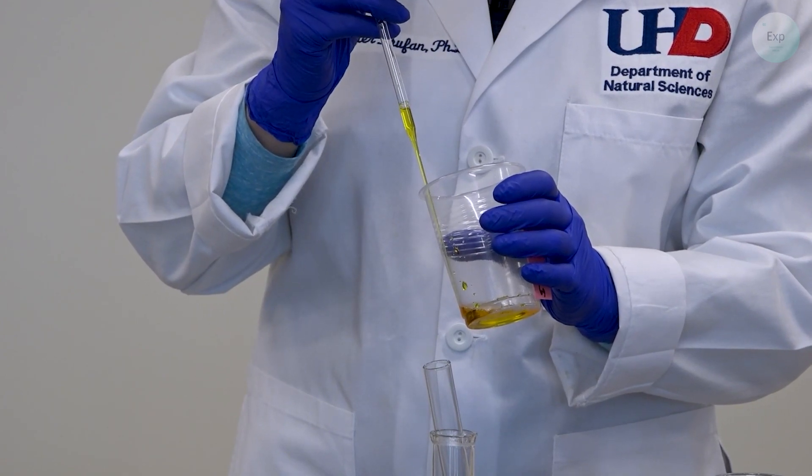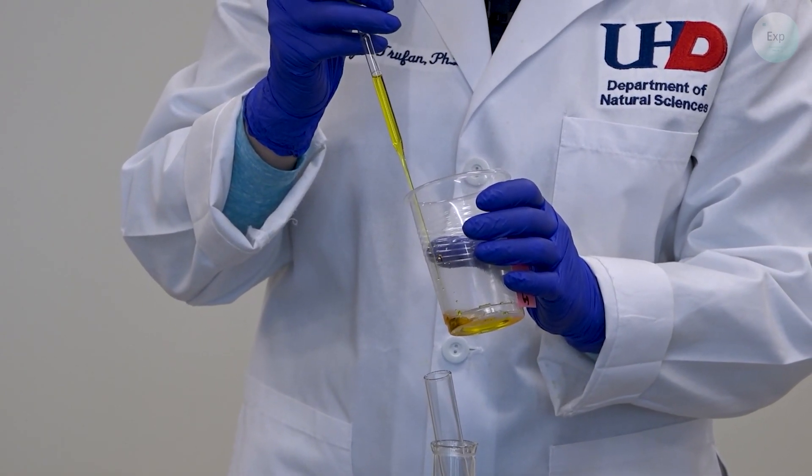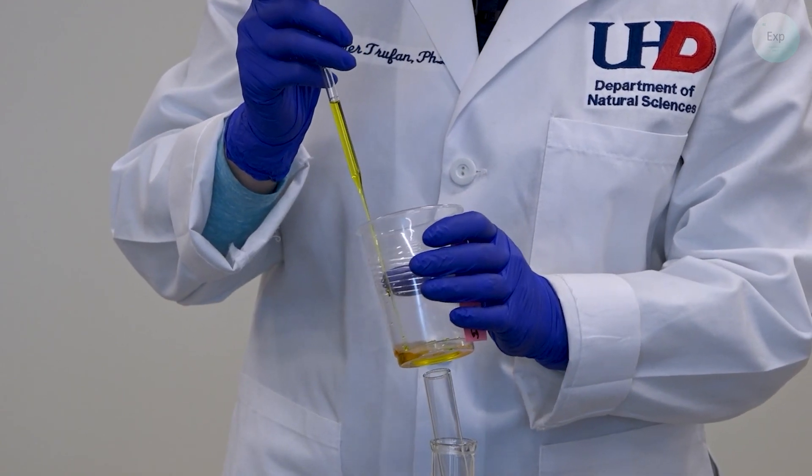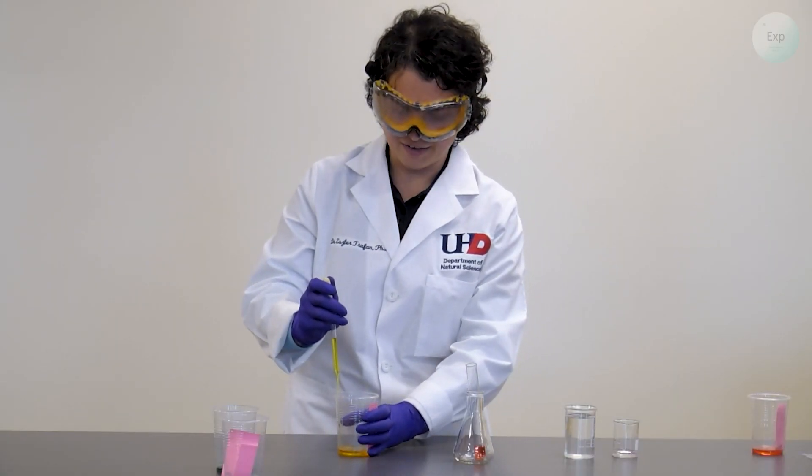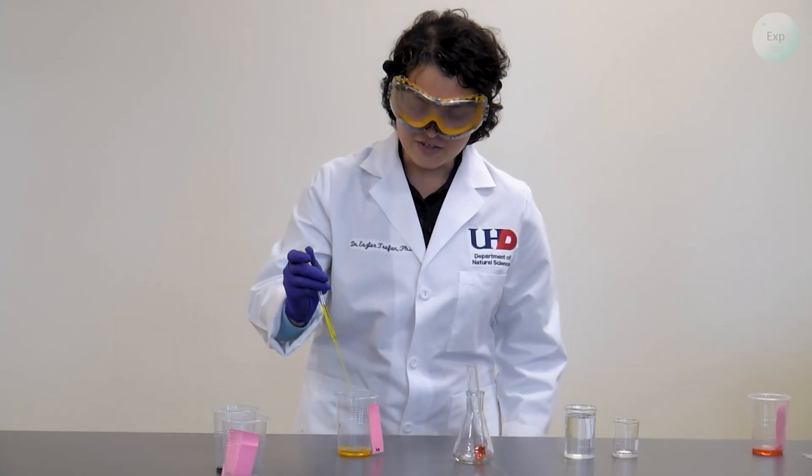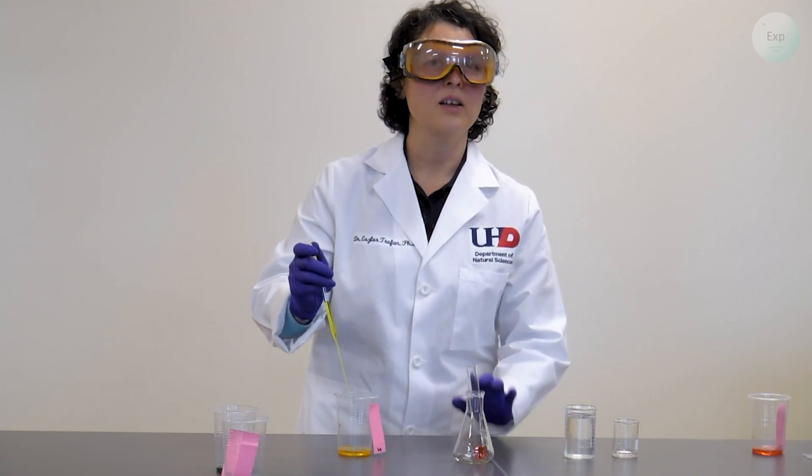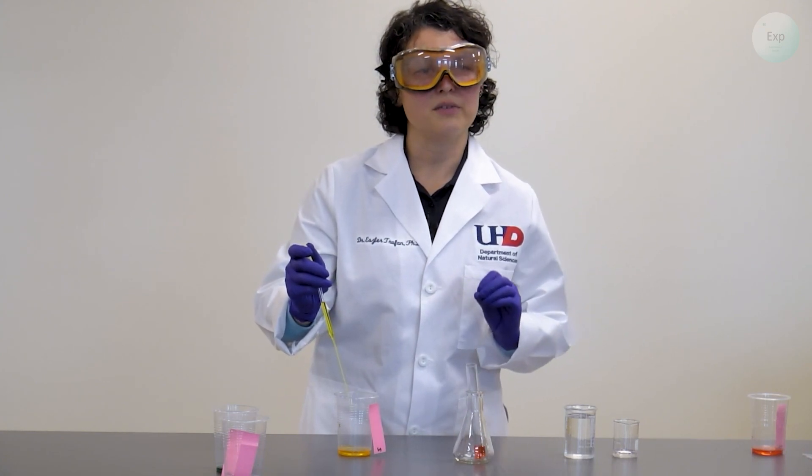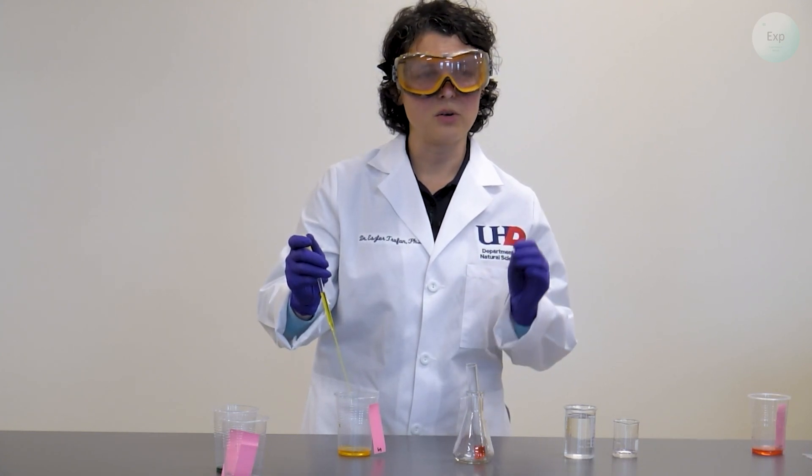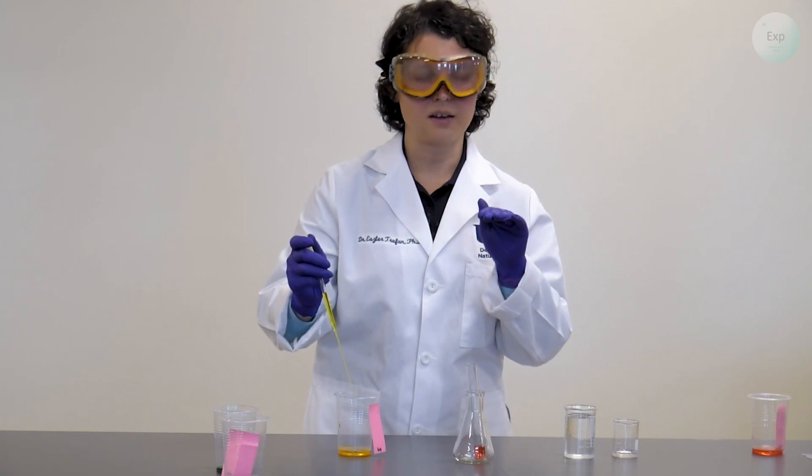When we are ready, we pull up a significant amount of the yellow solution and this is really important and critical. Very slowly and very carefully we have to transfer this content in there, but this time it cannot be rushed. It has to be very, very slow to create this layer between the red and the yellow solutions.